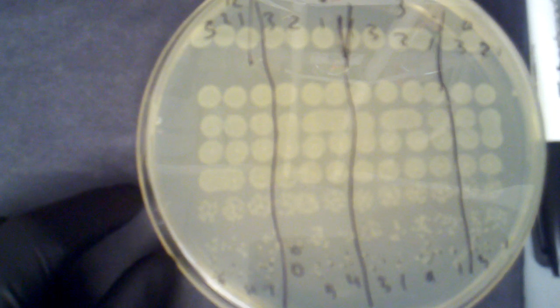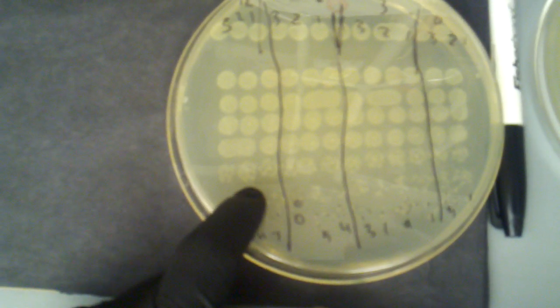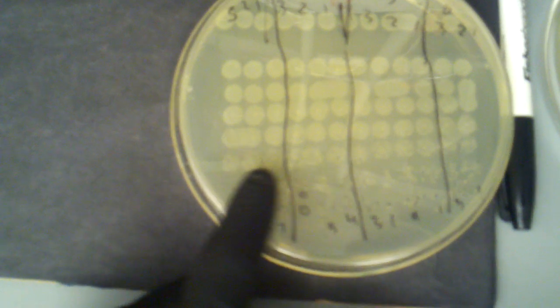There's one there, right there, and then another there, and another there. So luckily those are high dilutions, and I wouldn't have been able to count those anyways, but just be aware of that. Now if that had happened down here, I hope it didn't, it would also make it very, very difficult to count. So it looks like we had one there, but when the colonies are too far apart, it's going to be very difficult to tell if that actually happened. But you can just kind of look at the general pattern of things in order to QC it.